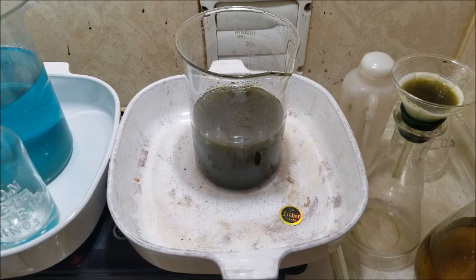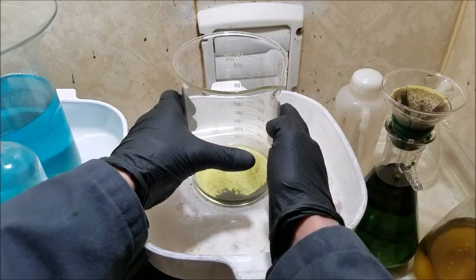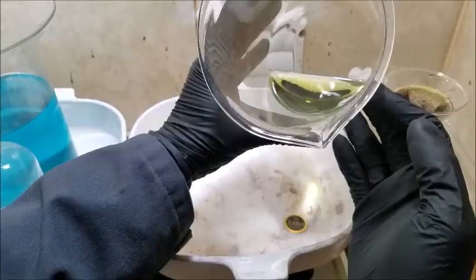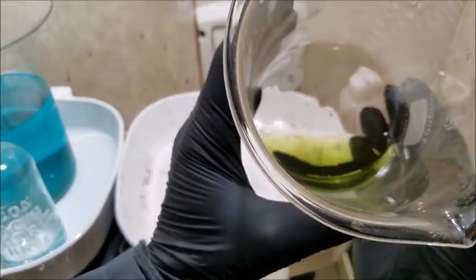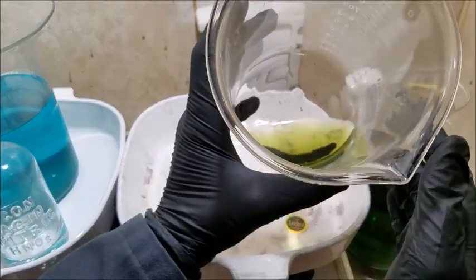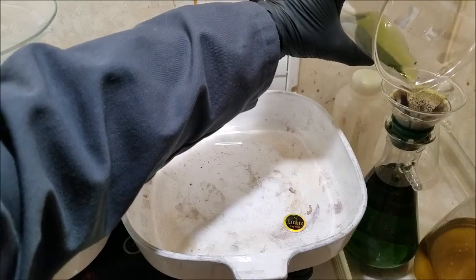When I get it down to the end or if anything exciting pops up, I'll tune back in. Alright, well, here we're to the point where I would normally say, well, here comes our gold. But I can't see it. This looks like a lot more than it really is, no matter what it is. But I'd be real surprised if all that we see in the filter is gold.